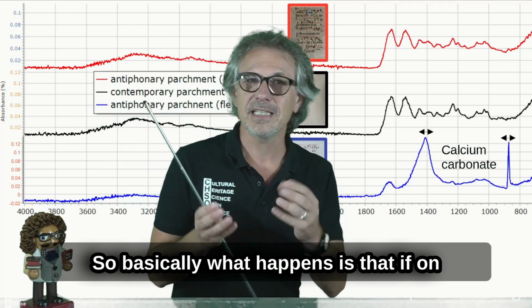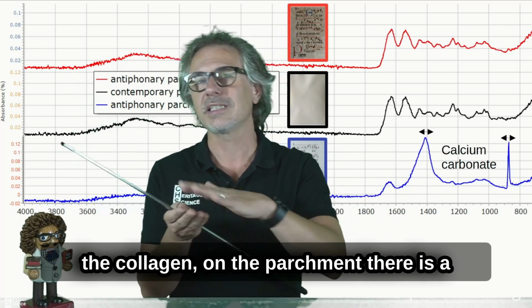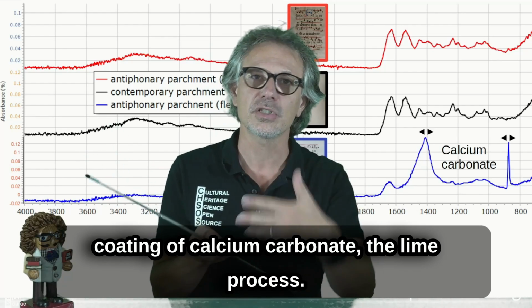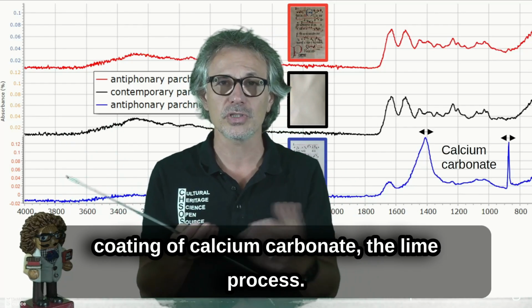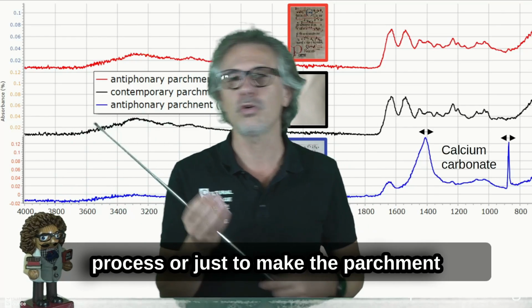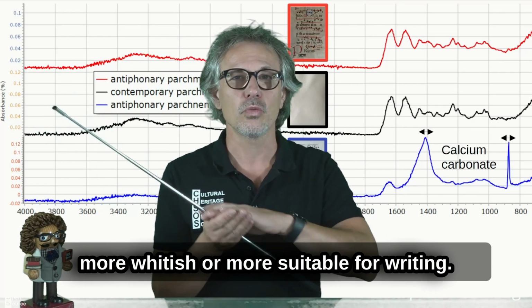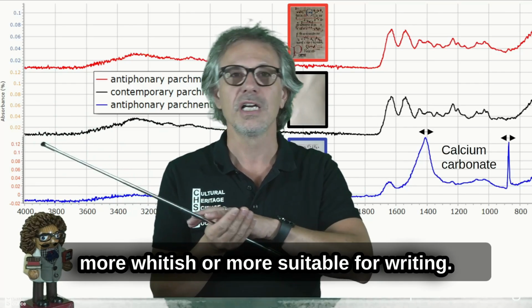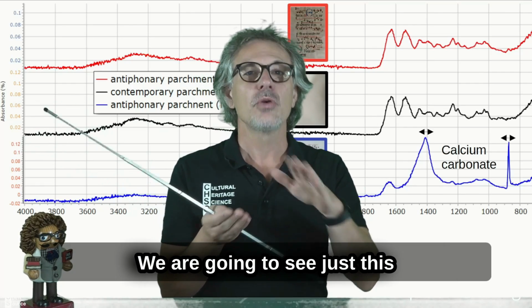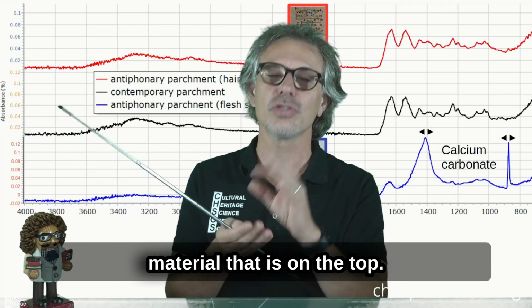So basically, if on the collagen, on the parchment, there is a coating of calcium carbonate, a lime process that could be due to the manufacturing process or just to make the parchment more whitish or more suitable for writing, we are going to see just this material that is on the top.